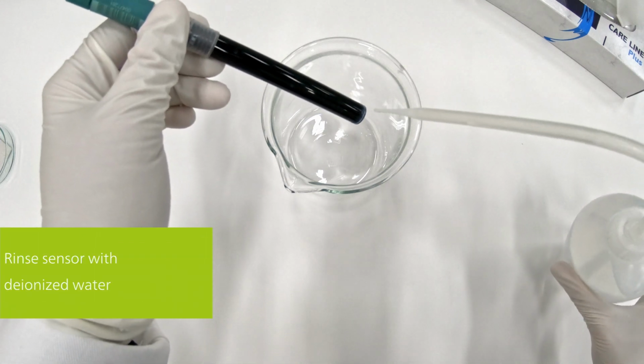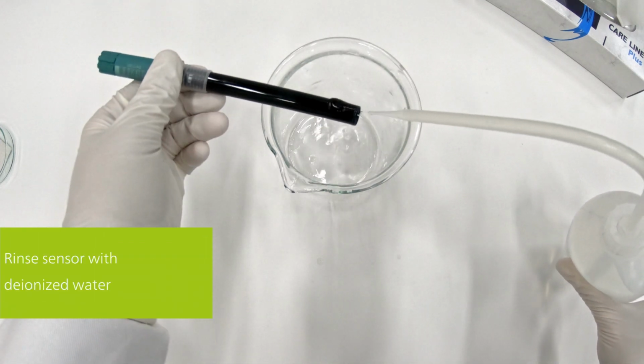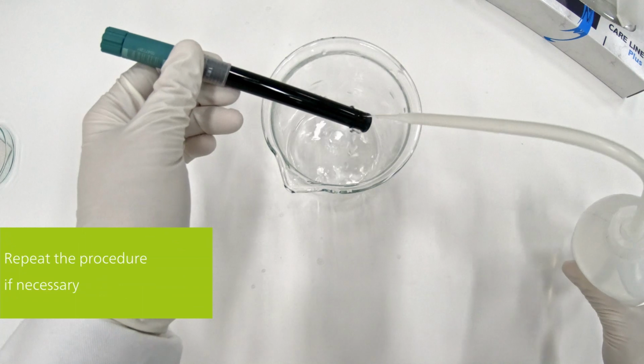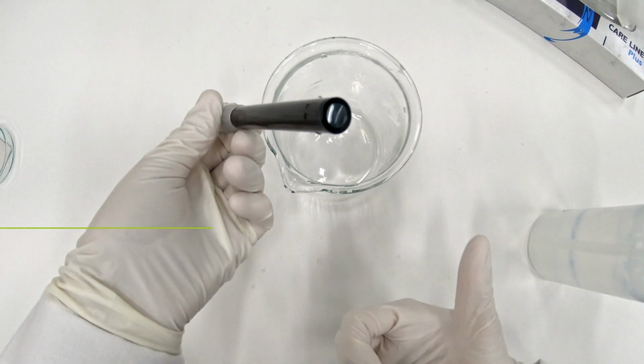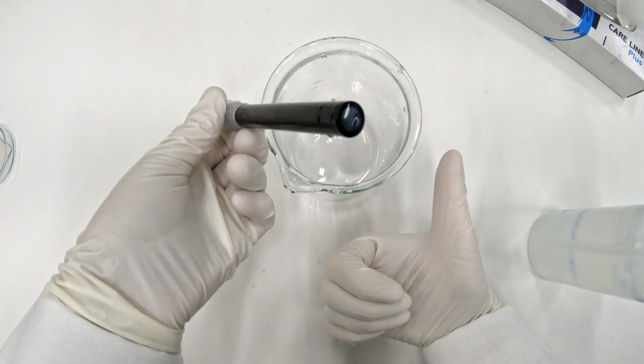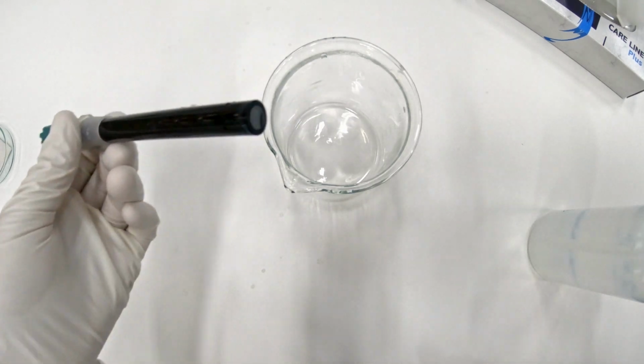Rinse the sensor well with deionized water, check the crystal membrane, and if necessary, repeat the procedure by adding new powder onto the cloth. If the sensor surface is clean again, it can be reused for your application.